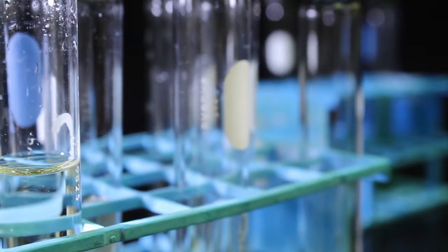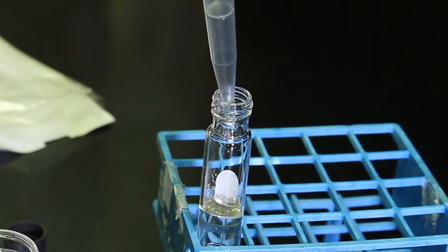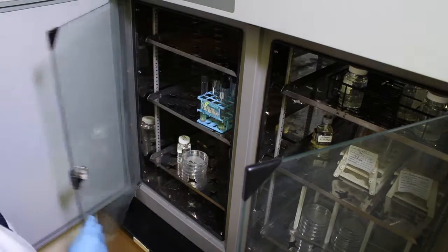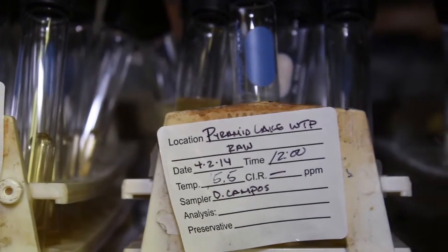Any gas produced will be trapped within the smaller inverted tube inside the main test tube. Often, this test is performed on multiple tubes, instead of the single one shown here, and sometimes with smaller sample sizes than the 10 milliliters. Once the sample is in place, the test tube is swirled to mix the contents, and then it is placed in an incubator. The incubator is a laboratory device that provides a dark, constant temperature environment.